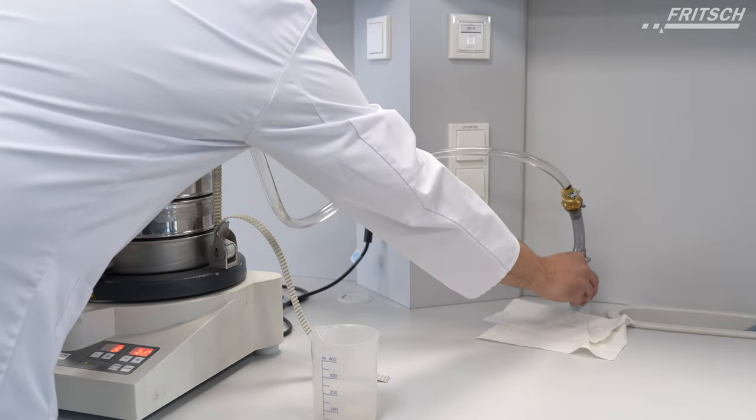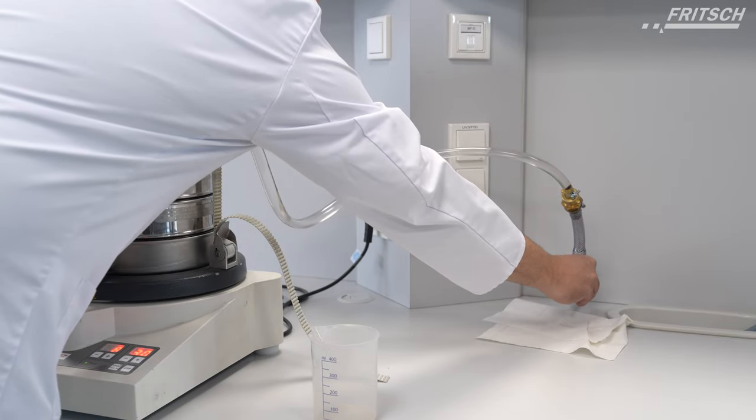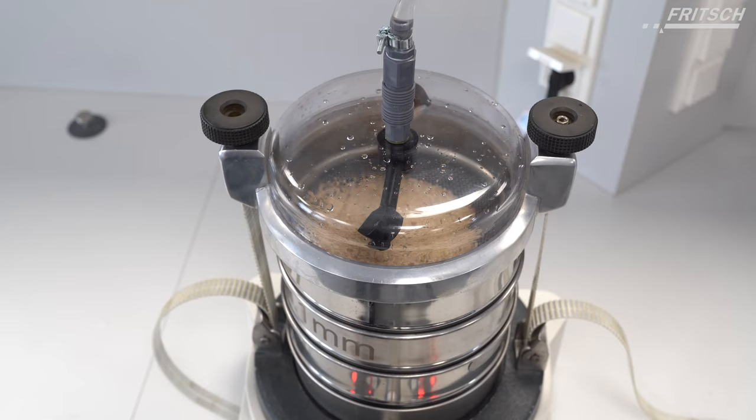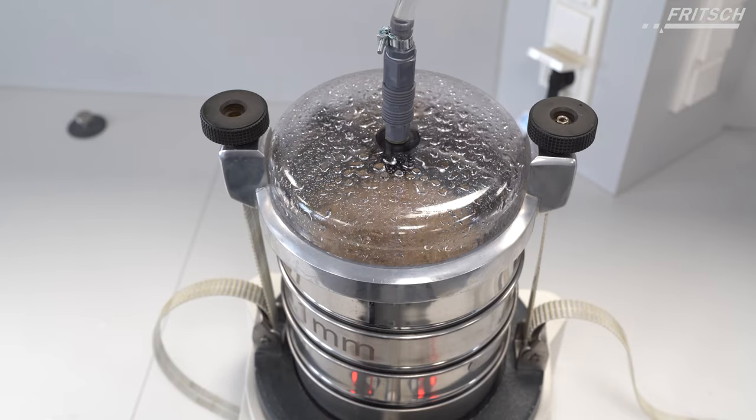Now we have to open the water valve, and please do not push it too hard so the pressure will not be too high.